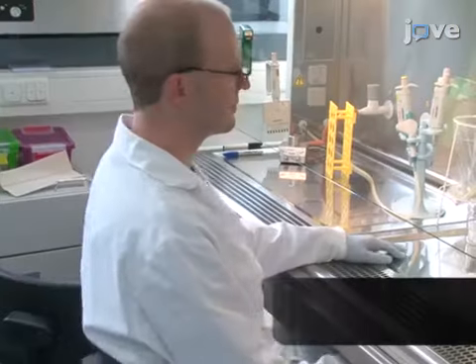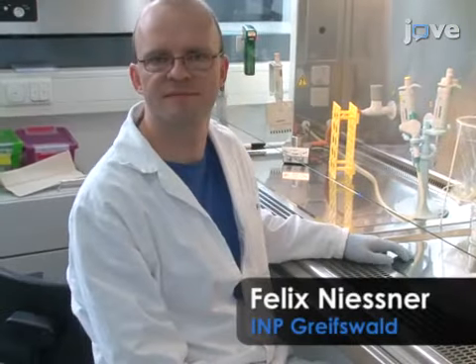The main advantage of this technique is its semi-automatized approach. It uses 96 well plates to increase speed and productivity of the research. The implications of this technique extend towards future plasma therapies, like in dermatology or oncology, as they provide the means to identify the plasma-derived reactive species which are relevant for the biological responses. Demonstrating the procedure will be Felix Niessner, a technician from our laboratory.